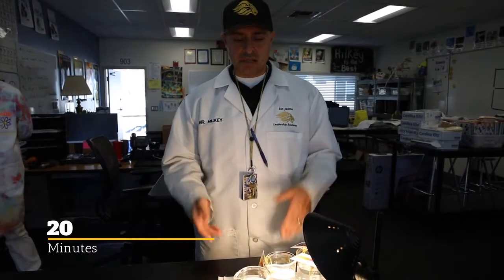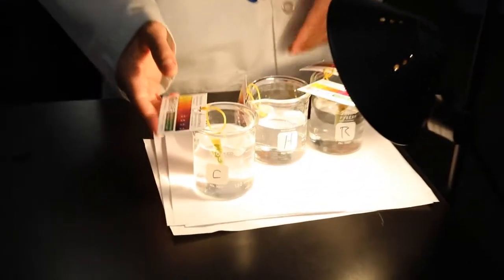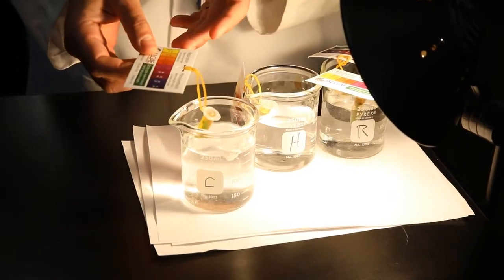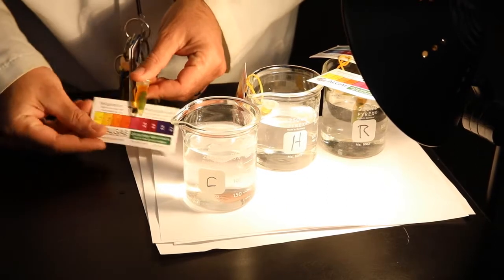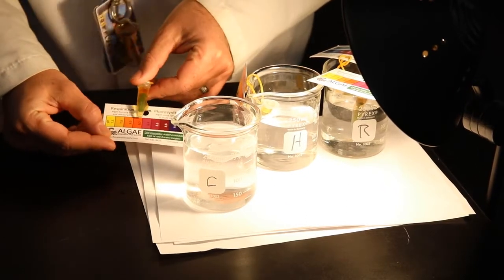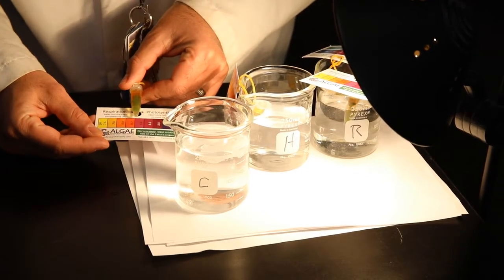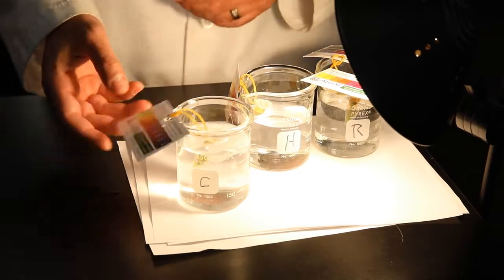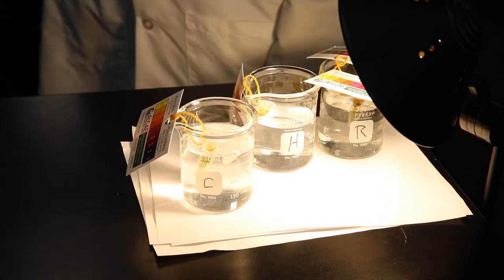Welcome back, Lions. Okay, we're back. It's been 20 minutes. We're looking at our beakers of our water, our cups of water. We got our cold one, so let's go ahead and look at this one and see how it's changed, and we record the data. Mr. Zamudio will put it there. So after about 20 minutes, first we had number 1 at 7.8, and it looks like it's sitting there close to about 7.9. So if you want to put 7.9 for number 1 next to the 20 minutes, Mr. David.